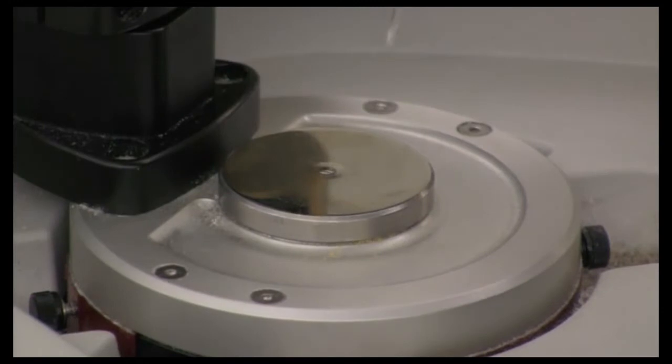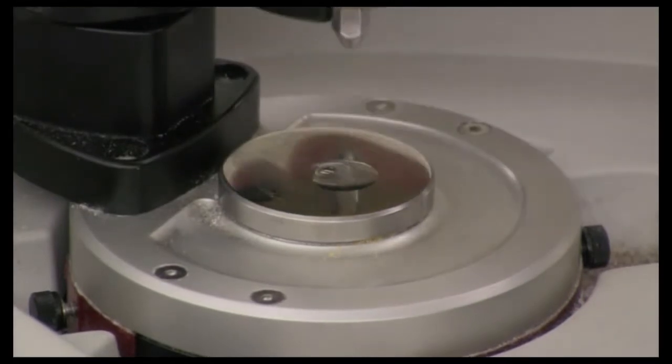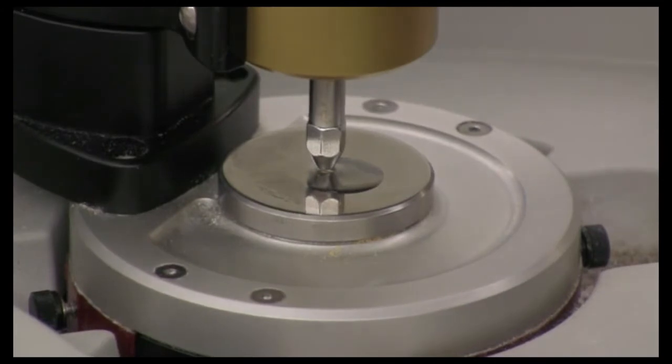Next, you want to place your sample on the opening where the diamond is on the ATR stage. If your sample's a liquid, simply place one drop over the opening, and then turning the anvil clockwise, turn it down until it just makes contact with the surface of the drop. This will trap the drop over the diamond opening, and in case your sample is volatile, it will not evaporate. So make sure you trap the drop.